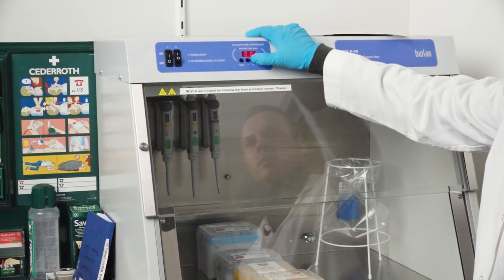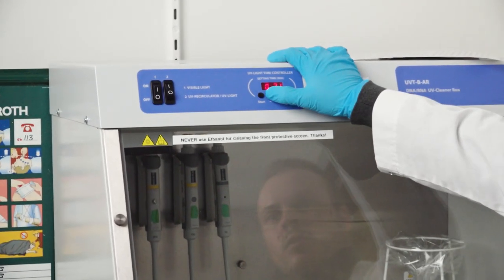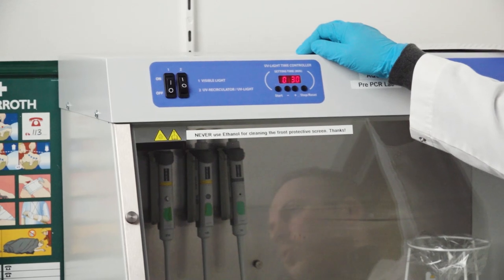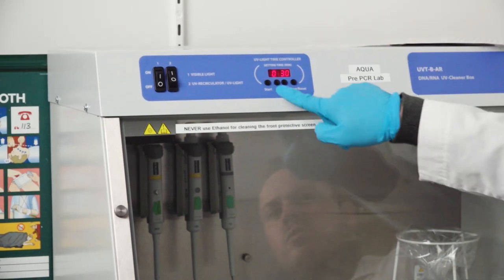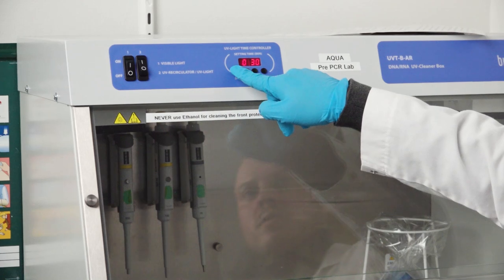Then we hold the plus button until it goes up to 30. If you go up above 30 you just use the minus button. And then we push start.